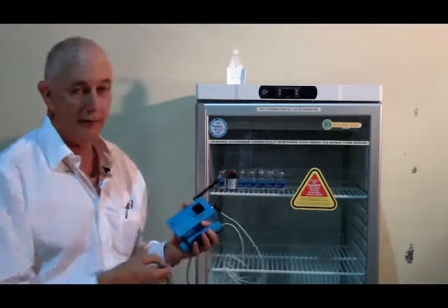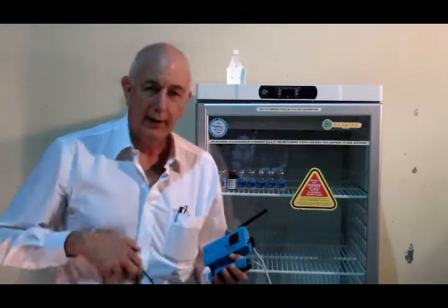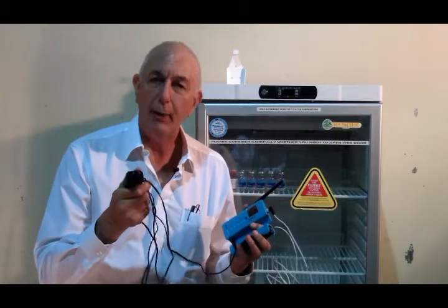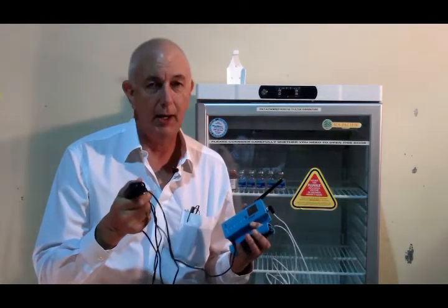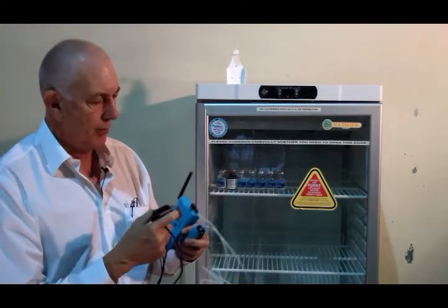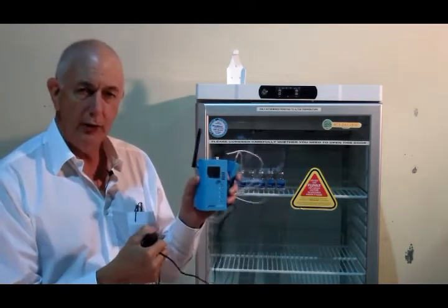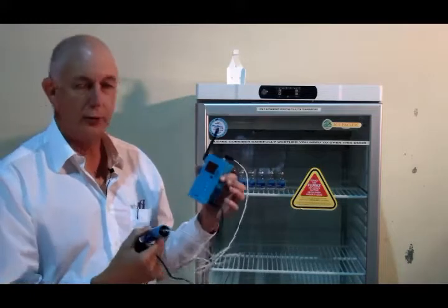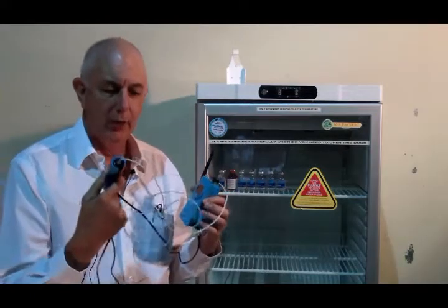They come with a little power pack which plugs into a mains power point at some handy location near your fridge, and the probe is connected to the top of the unit via a little screw-in probe. That's the probe sensor.